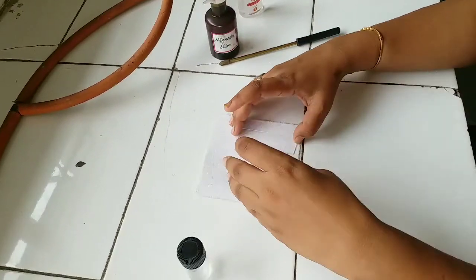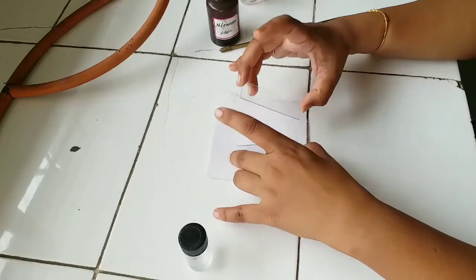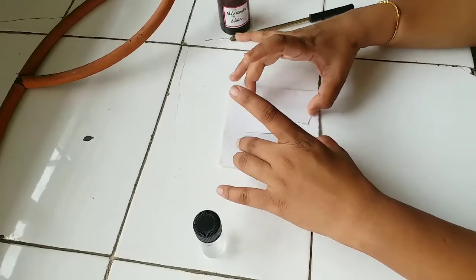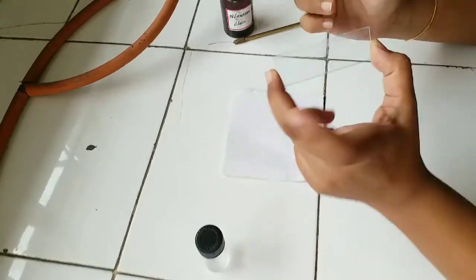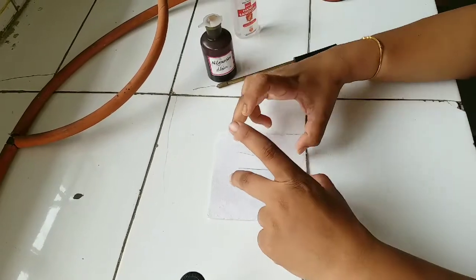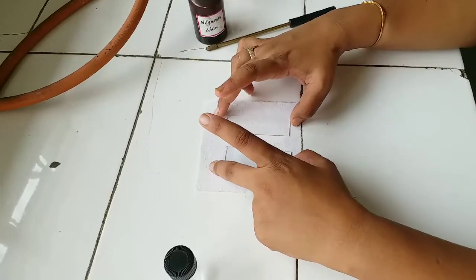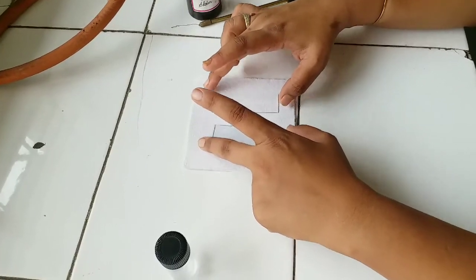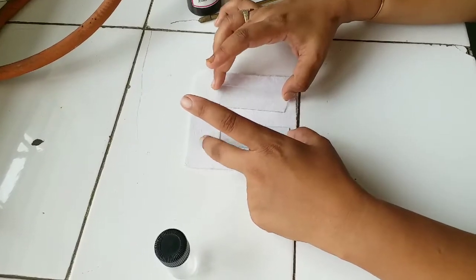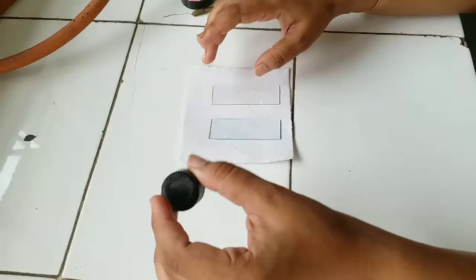The requirements for this practical are: you have to take two clean slides, clean the slides with the help of alcohol or acetone, and you need a bacterial culture.